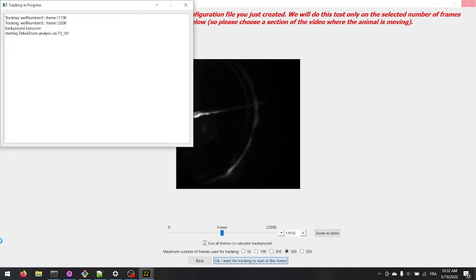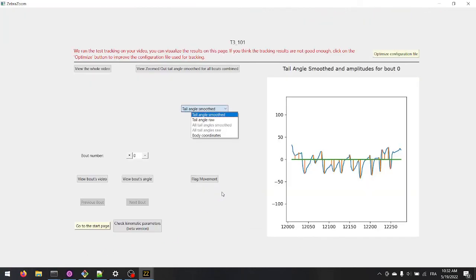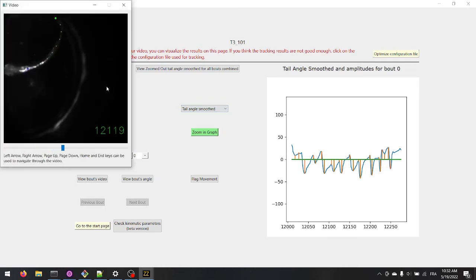While the tracking runs for a few seconds, you can check the console to monitor progress. On this tracking validation page, check that the tracking worked well for your entire video. It looks like the tracking might be working well, however, it is hard to tell for sure because of the poor contrast of the video.